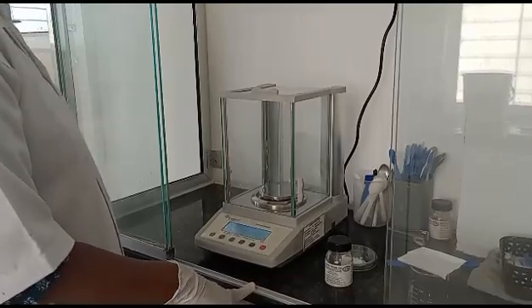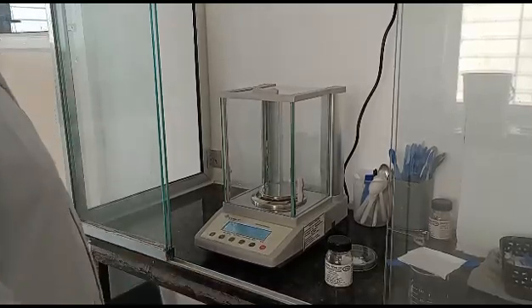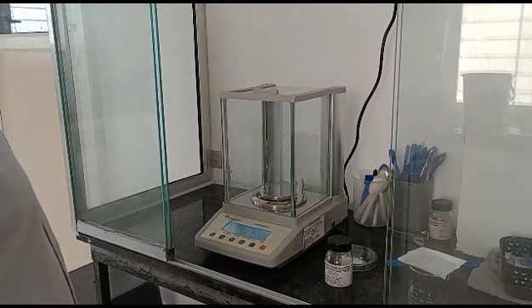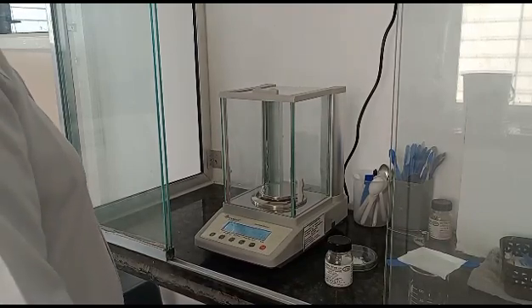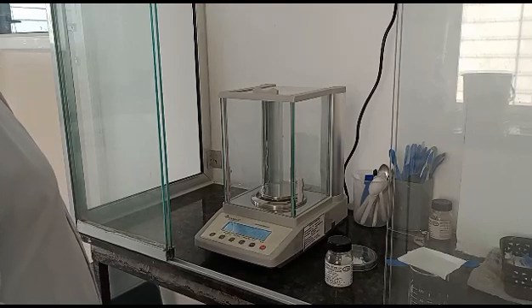Hello and welcome to Kulkarni Laboratories. In today's session, we will see how to standardize 0.01 molar EDTA solution.